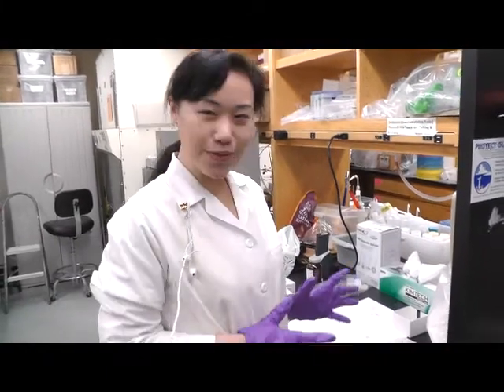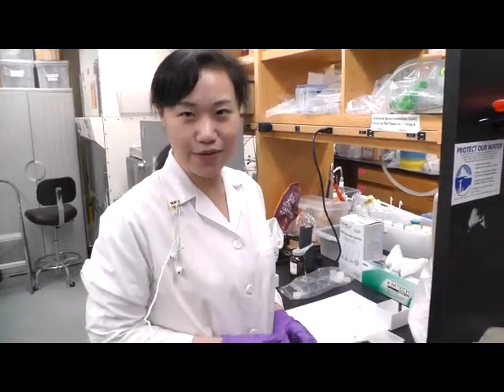Hello, today we are going to show and demonstrate how we are going to make XRF cups for soil and dust samples.